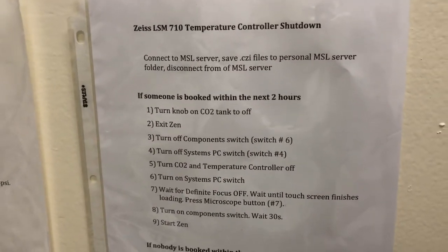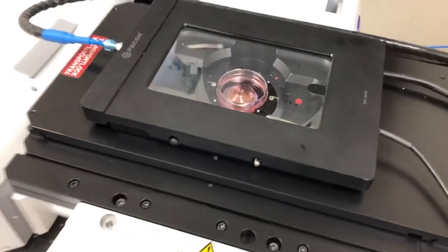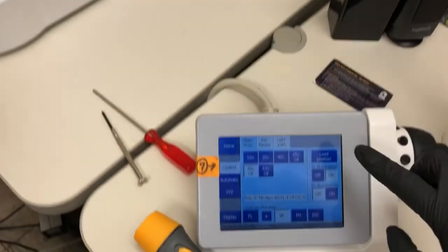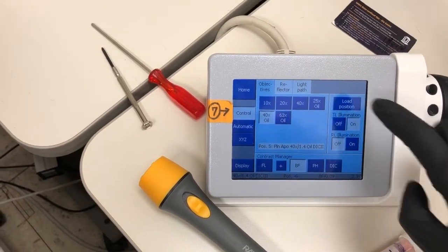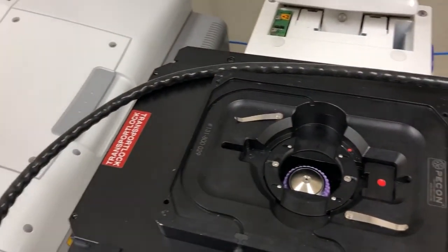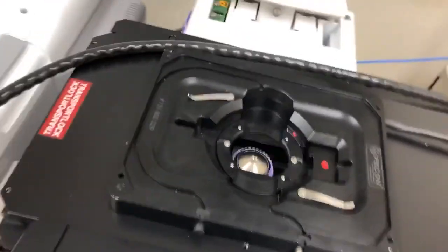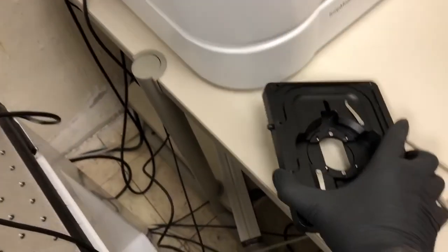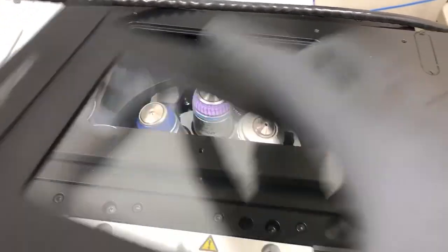The other thing, the shutdown instructions for the temperature controller here when someone else is coming. Now we need to put this back in position. So you can see I was using a 40X oil objective. Before I remove it, I want to go to load position to lower that objective. You can see it's far away. Now I can open this up, remove this sample. And I can now remove this very gently, place it on the side table here, and do the same for the lid.